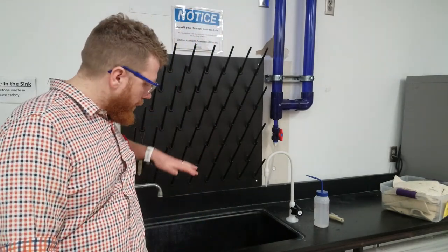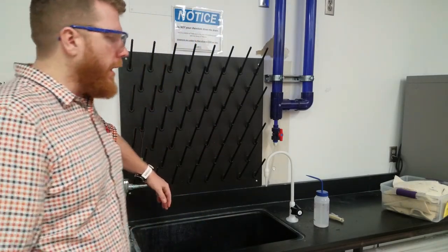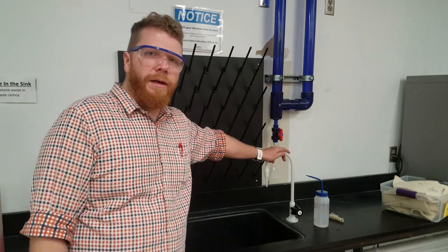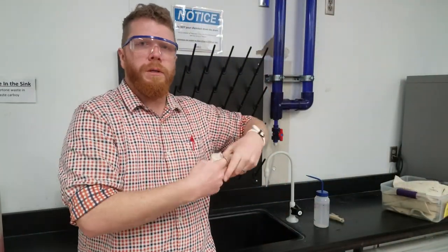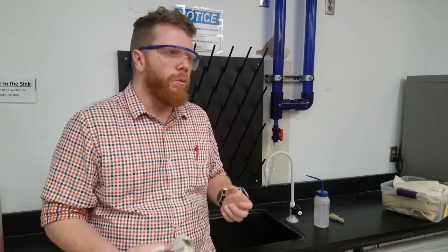I hope you enjoy the lab — good luck with everything. Of all the glassware you're using this week, make sure to triple rinse everything with tap water and then triple rinse it with deionized water. After that, get a paper towel and make sure you dry it out completely. We're working with an acid this week, so you want to make sure the acid is completely gone before you put any glassware back into your bin.